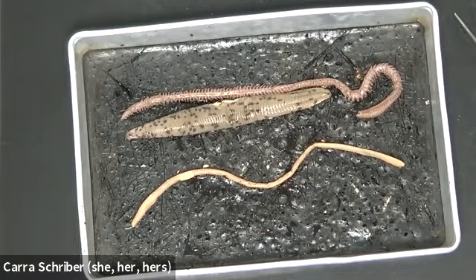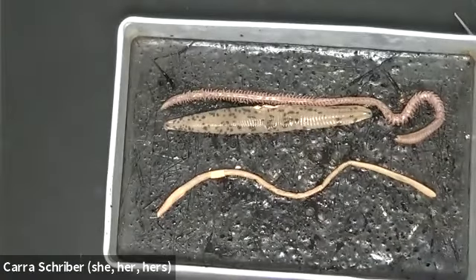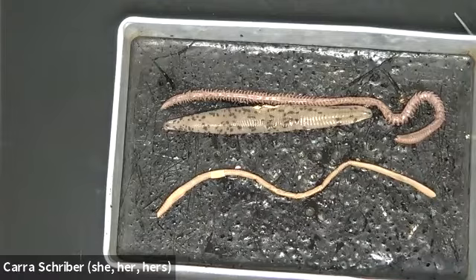And it's hard for us to think about that because this is just our homely earthworm, right? But because of that coelom formation, because they are true coelomates, they really can have the complexity of organ formation and all of the rest of that goes along with coelom formation.